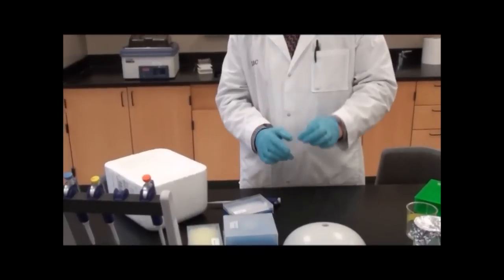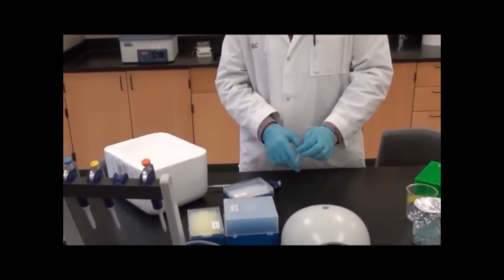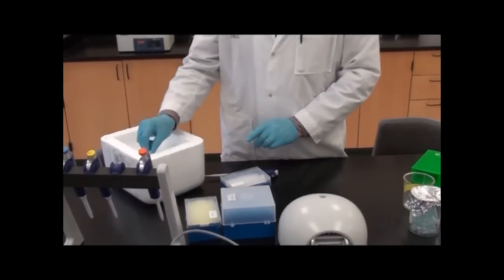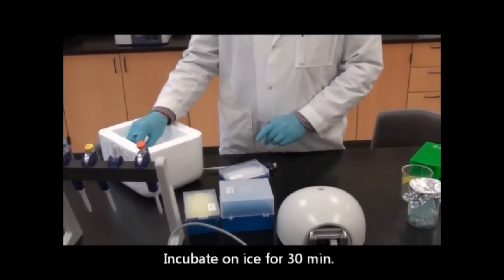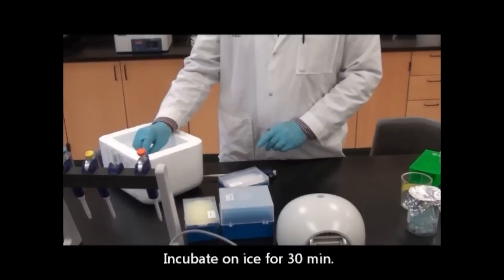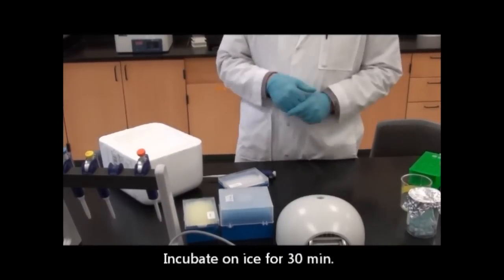I'm just going to flick the bottom to mix it in there. This is mixing by flicking. Do that a couple times, and then I'm going to put it back on ice and incubate it for about half an hour, and then I'll perform the heat shock.